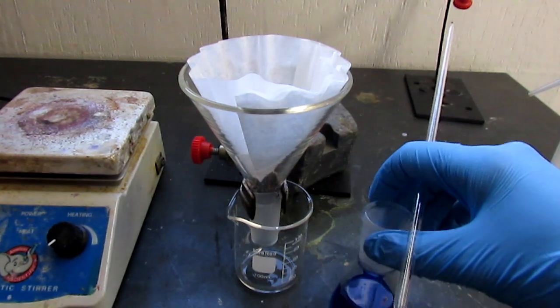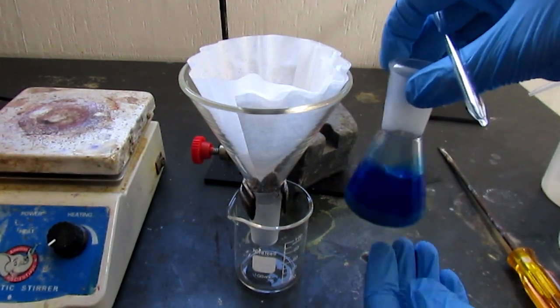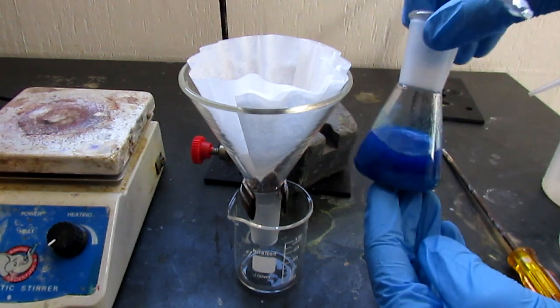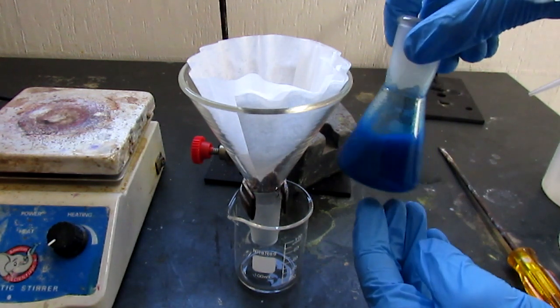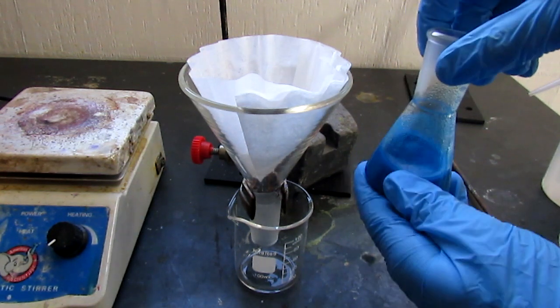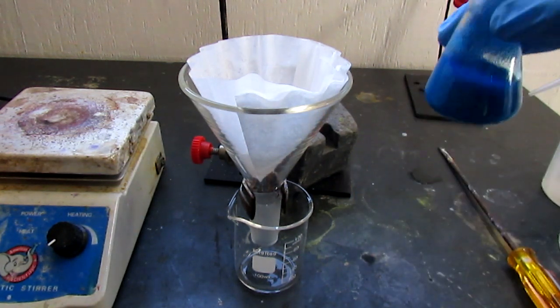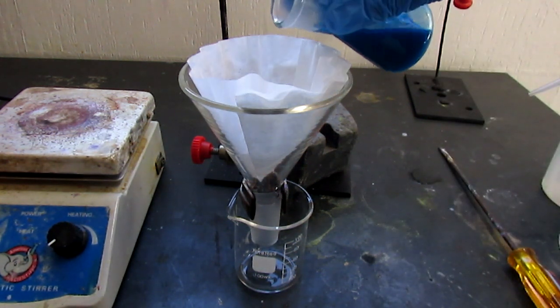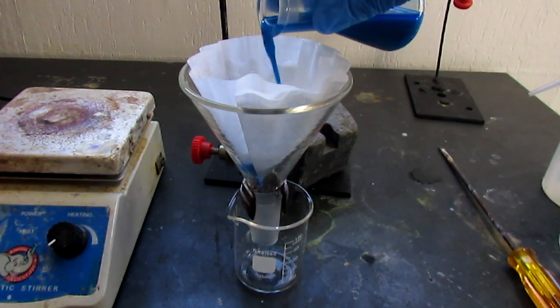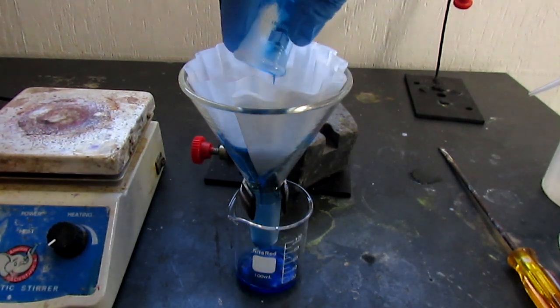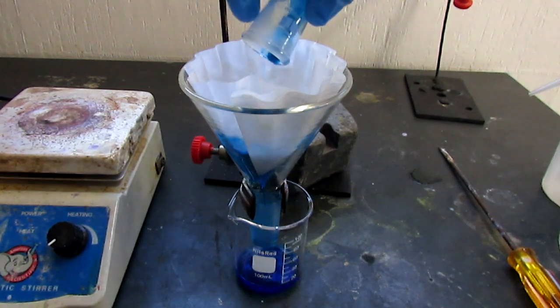The product seems to have caked in the bottom. When I stir it, you see it doesn't actually - okay no, it is coming up. It's not quite room temperature but I'm going to filter it now. Let's get that done and then after I'll wash it with a bit of ice cold isopropanol. Hopefully not too much makes it through this coffee filter. No, it looks good.